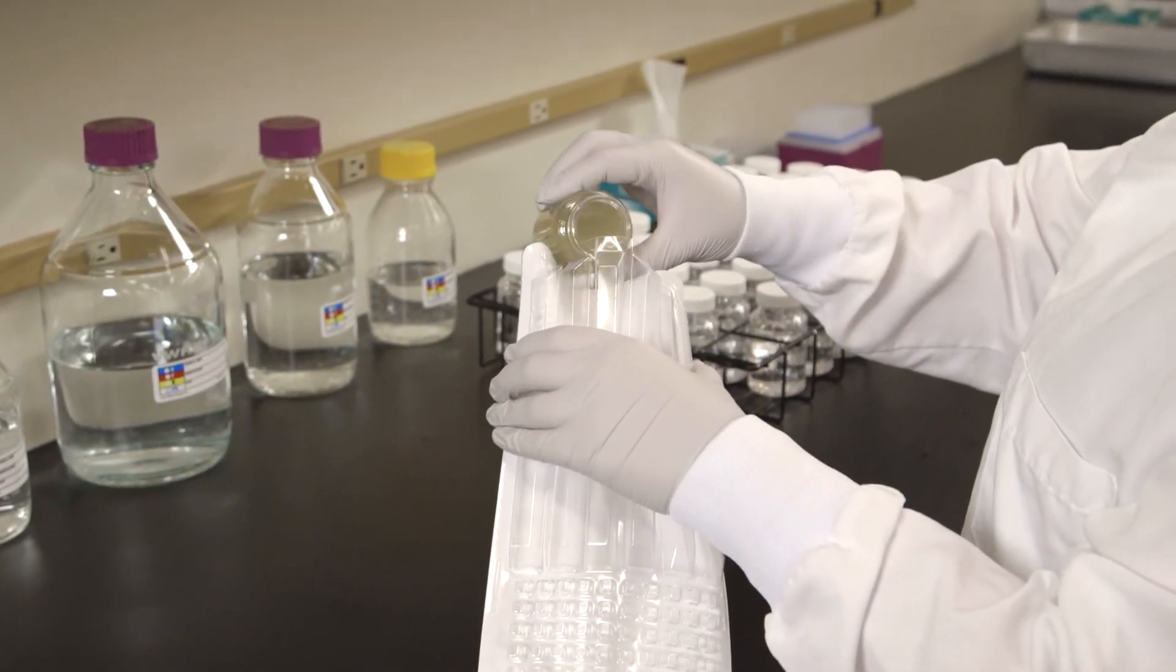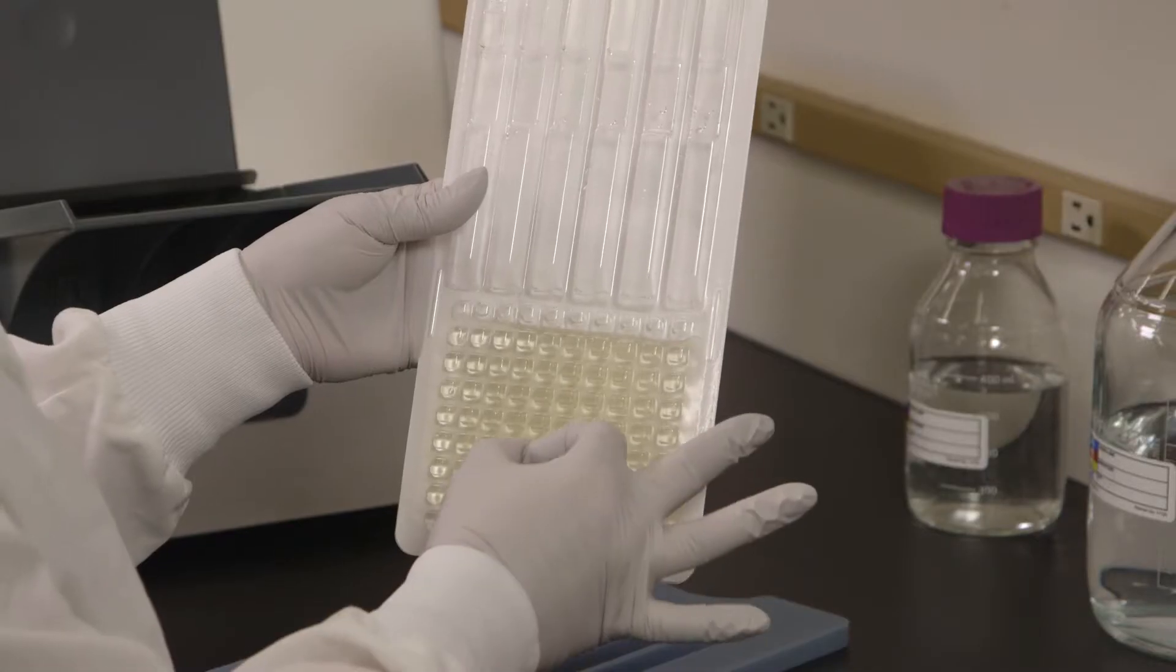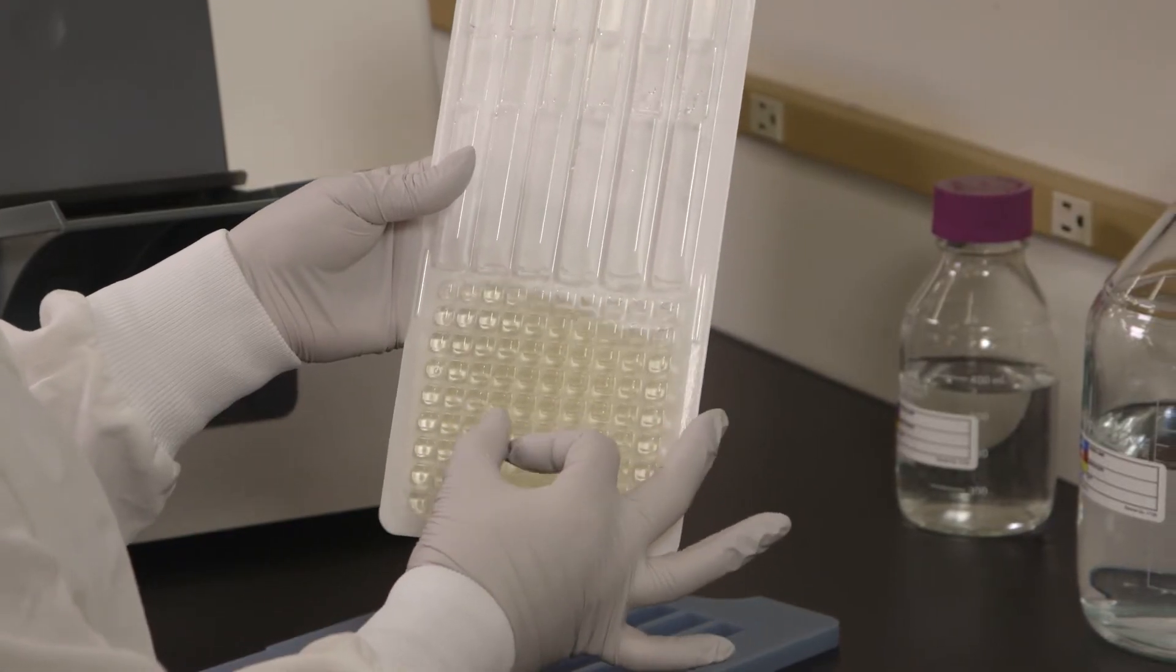Aseptically pour the sample mixture into the tray. Tap or flick the tray to remove air bubbles.